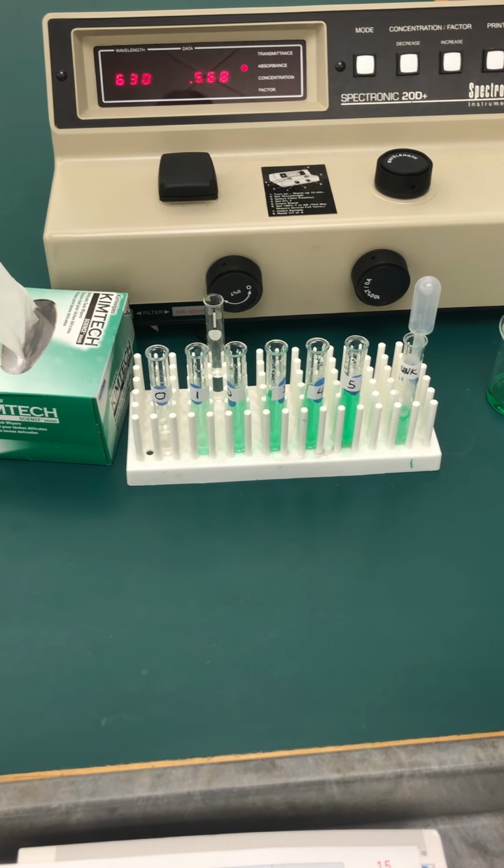In most cases, we pour everything into your waste beaker and then take that to the appropriate chemical waste container. The glassware has to be rinsed out properly before it is returned. You don't have to pour the washes of the glassware into the waste container, only the primary chemical waste. Okay, I hope you enjoyed that.